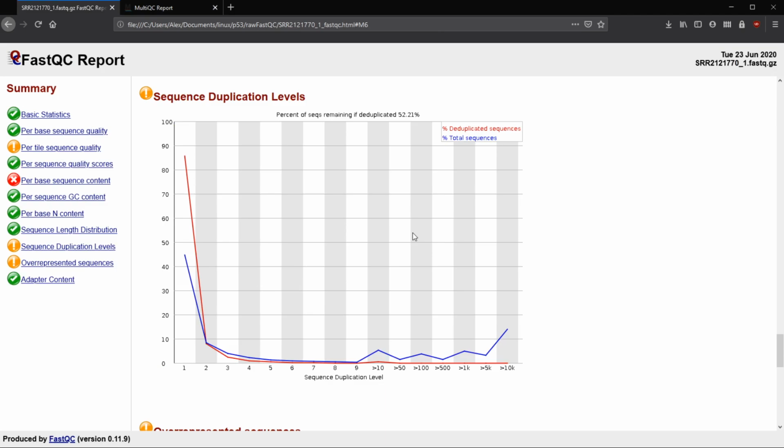Anyway, this can be because of a PCR bias. So if you have a sequence that is amplified a lot for PCR, that could be influencing this. But for genome sequencing, we want most to be just 1, right? Because we don't have that difference that we would see in RNA-seq, where we have some cDNA in the library being more than others. So for RNA-seq, this could happen because we have some of those higher expressed mRNAs or lower expressed RNAs, which would show up here.